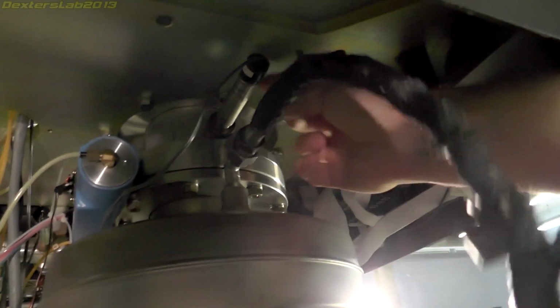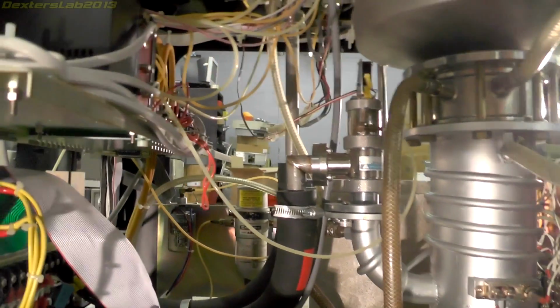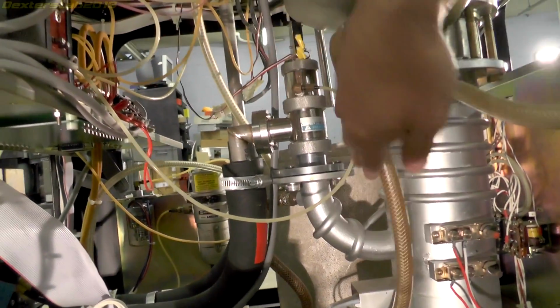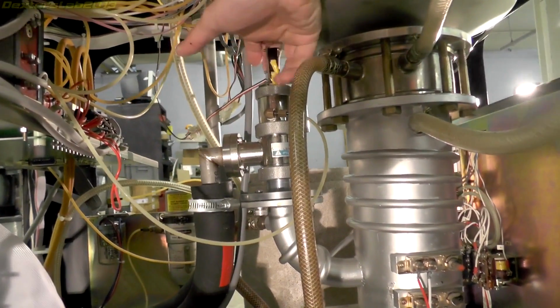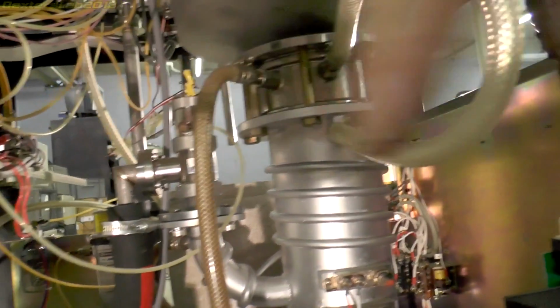There's a number of gauges. I think that's a Pirani gauge just up here. This looks like it's some kind of switching valve. There is also a small micro switch attached to the top of it.